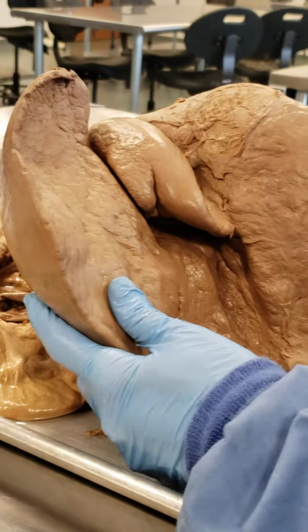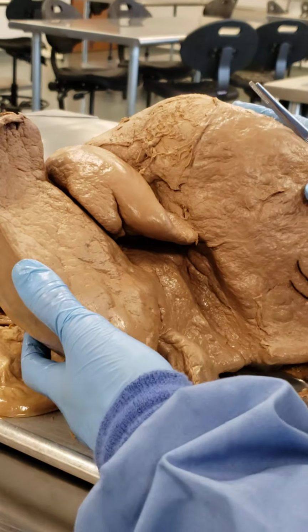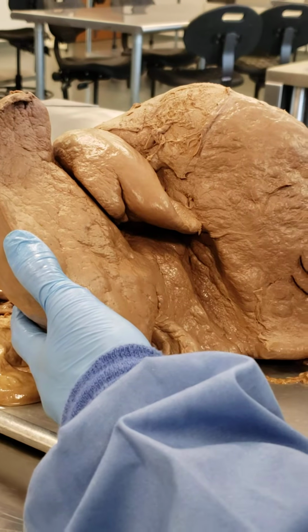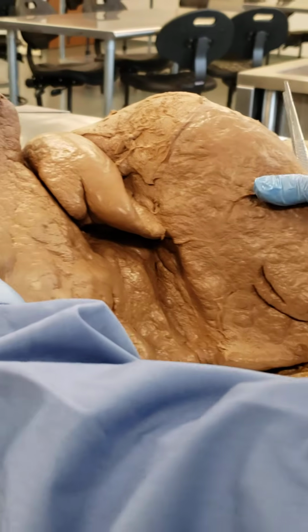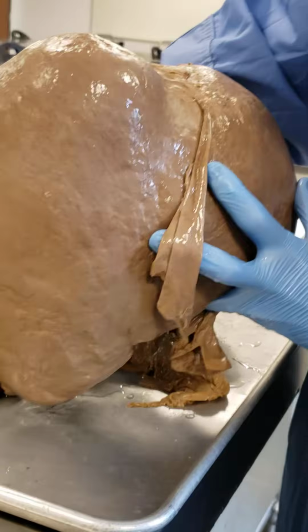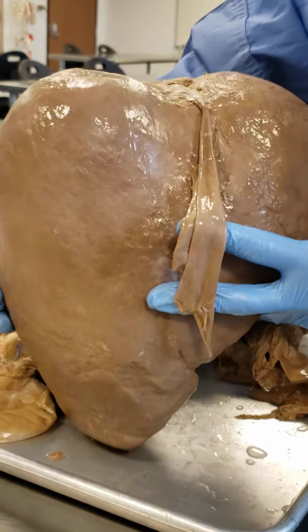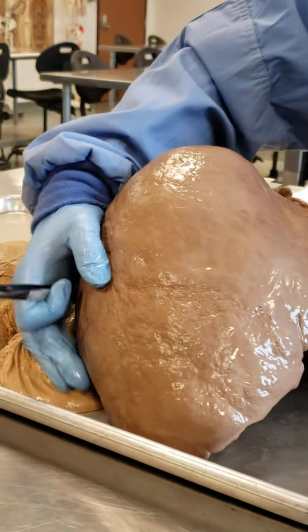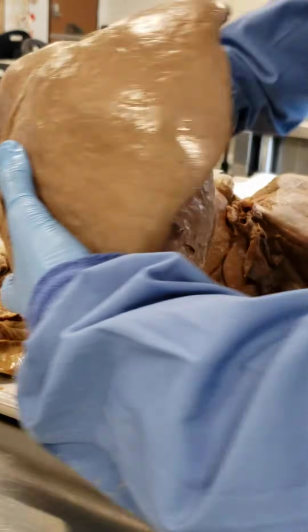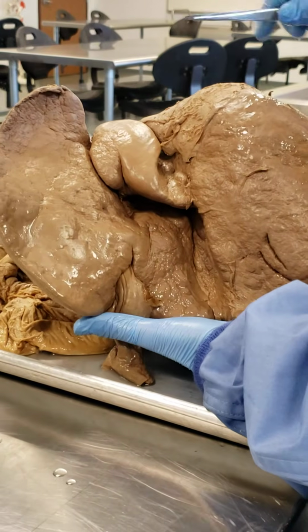So again, if we focus on an accessory organ, because we just mentioned the pancreas and gallbladder, 2 of 3 of the accessory organs of the digestive tract. Here is the posterior aspect of the liver. This is quite a large liver, yes, hepatomegaly is what this is representing for us. Here is my falciform ligament, all right? And I'm turning this liver around, and I just wanted to identify for you the other lobes of the liver that we talked about earlier.